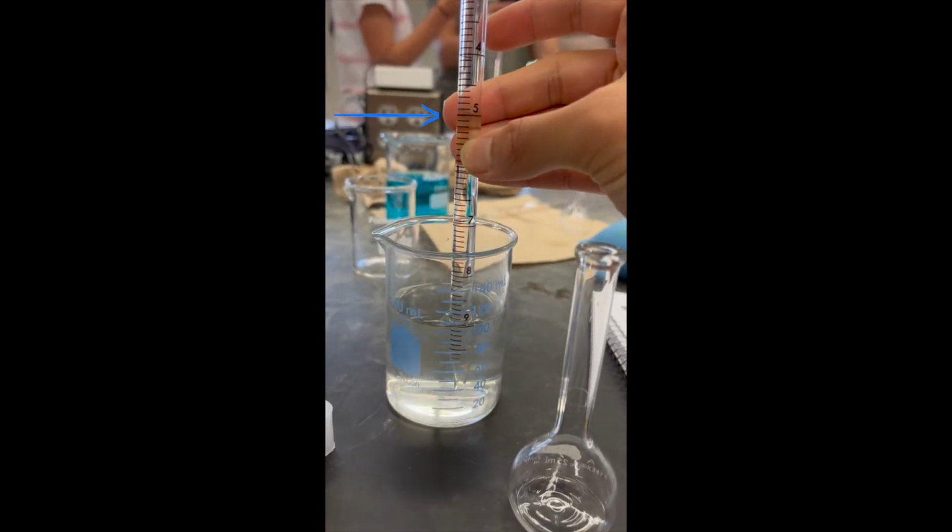The meniscus shown here is a curve that occurs at the top of a solution when dealing with glassware. It occurs because of the tendency of the solution's molecules to adhere to one another, as well as the tendency of the solution's molecules to adhere to the glassware's polar molecules. When calculating the volume of solution with glassware, be sure to use the bottom of where the meniscus forms, not where it adheres to the glass.